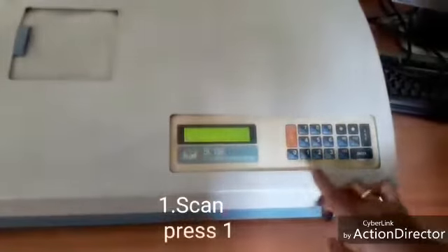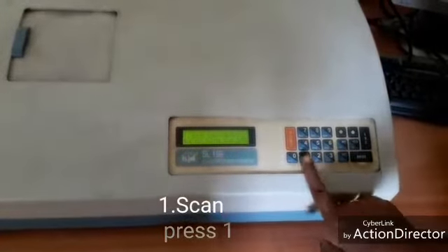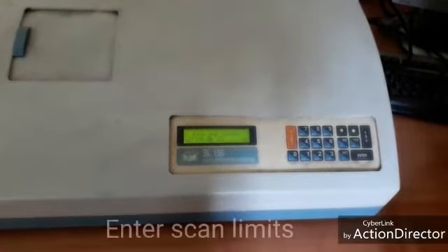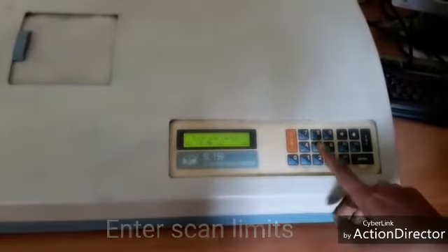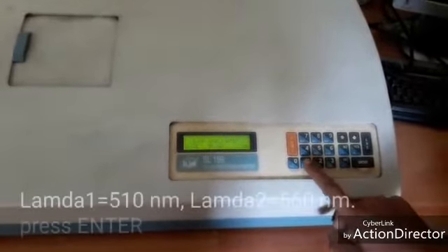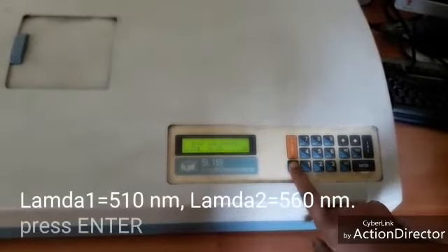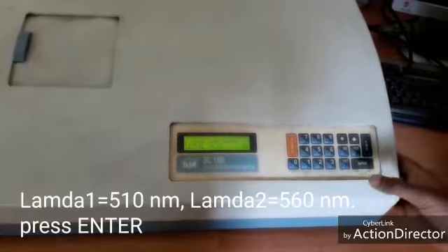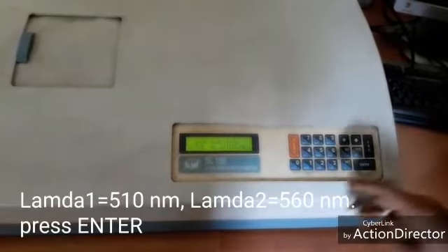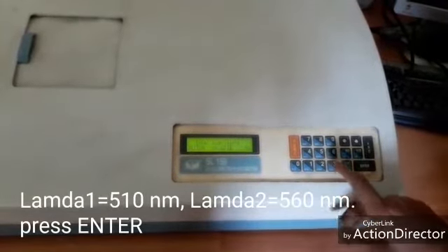Press 1. 1 is scan. Enter scan limits. 1, 510 to 560.